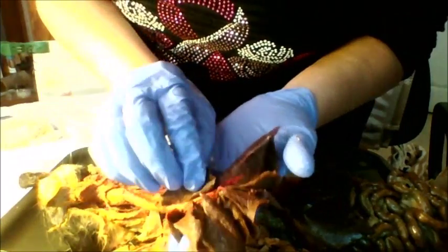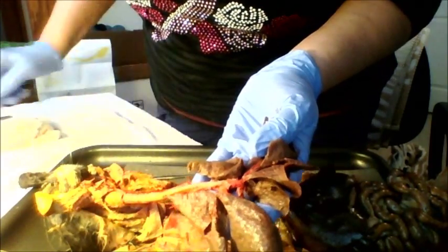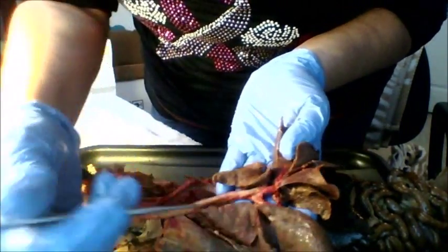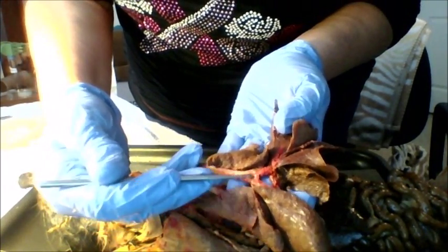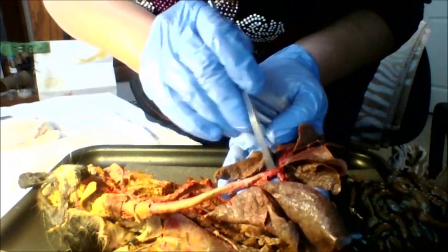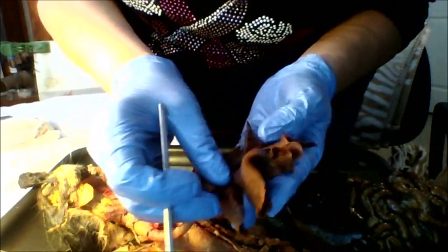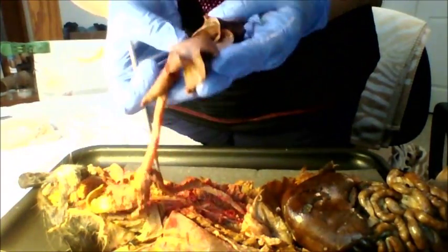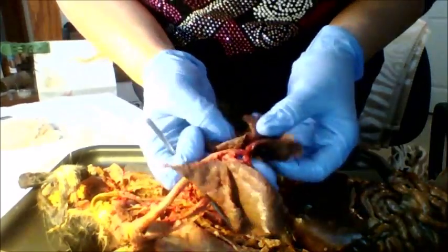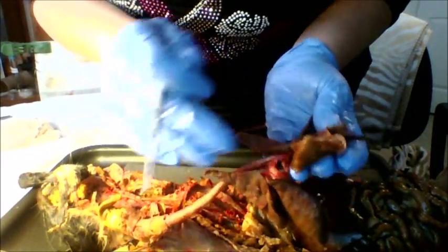And if you notice, you can see very clearly where the trachea bifurcates, and we have our right bronchial branch and the left bronchial branch. Our cat has 3 lobes on one side, 4 lobes on the other. And I'm sorry, but I'm getting tangled up in my cat here. 4 lobes on the other, 1, 2, 3, 4.